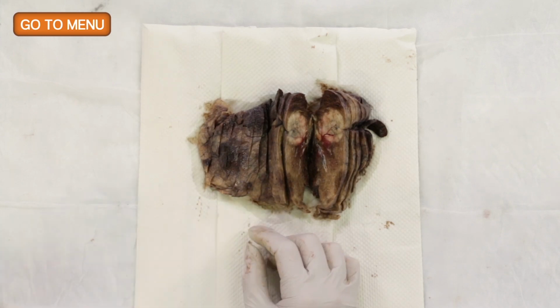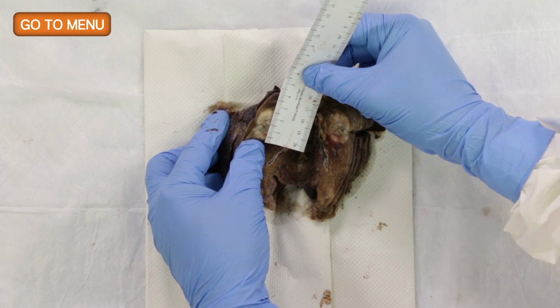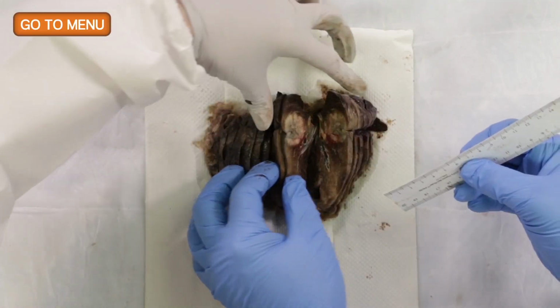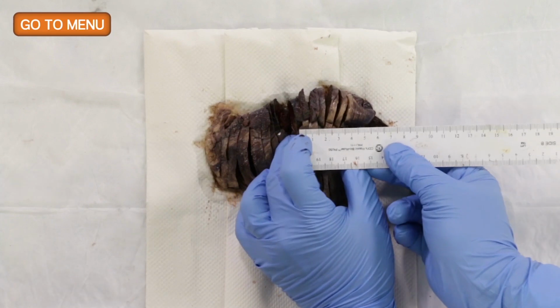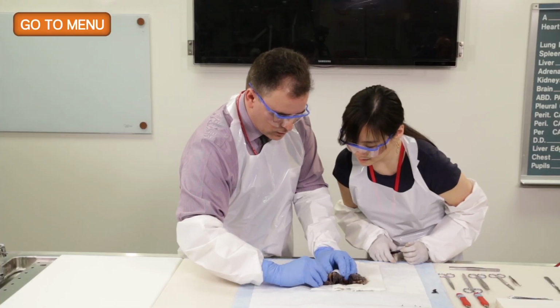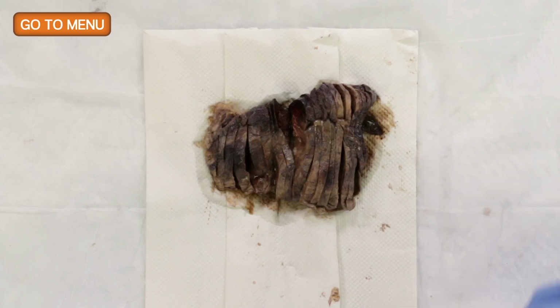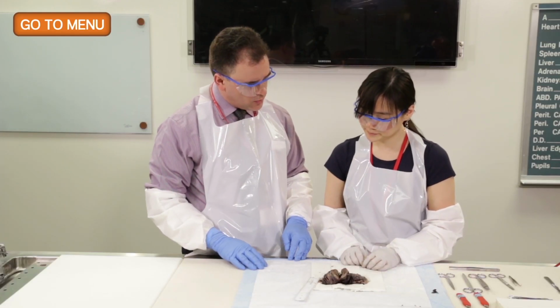Okay, sounds good. You'd like to measure which dimension? There's this dimension. Is that the largest? No, it's not. So which dimension would you want to take? Well, I would actually like to stack the mass together and try to measure it here. Exactly. And so what measurement do you get doing that? Let's see, the other extent is here, so what measurement do you get? 4 centimeters. Okay, 4 centimeters is right. So now that we have dimensions on the tumor, what would you like to do next?